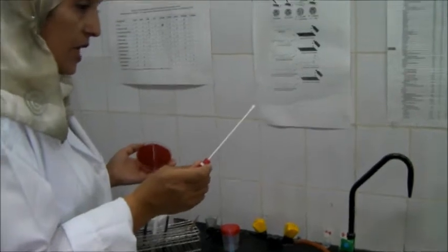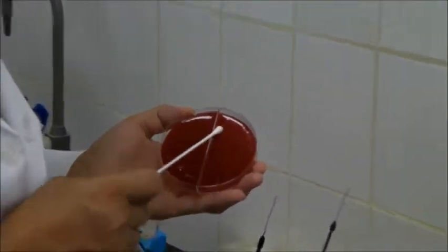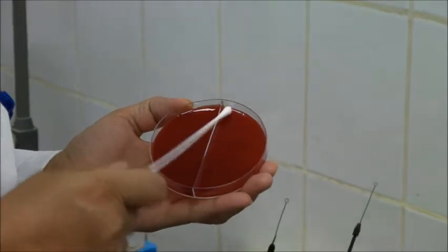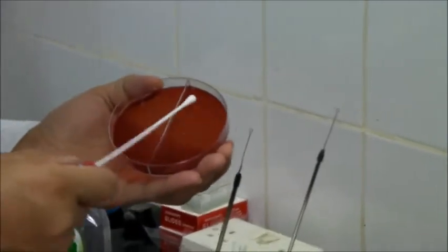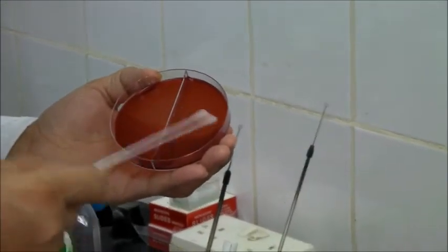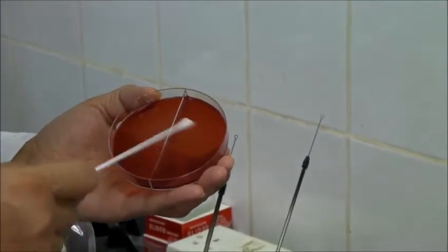We bring blood agar and MacConkey agar, and we transfer the secretion from the throat swab directly to the blood agar by rolling the cotton swab in the first portion of the plate. The remaining secretion is also inoculated on MacConkey agar.